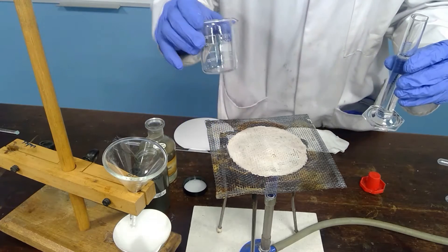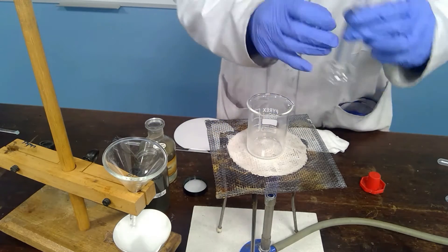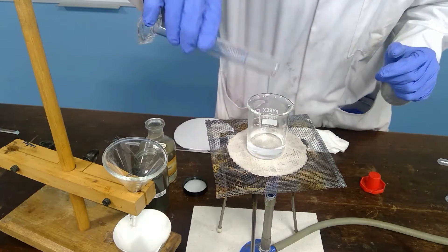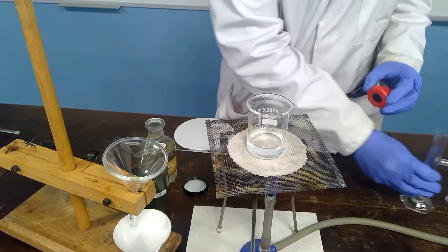It doesn't have to be accurate because we are aiming only to make some crystals of copper sulfate and we are not doing a quantitative experiment.